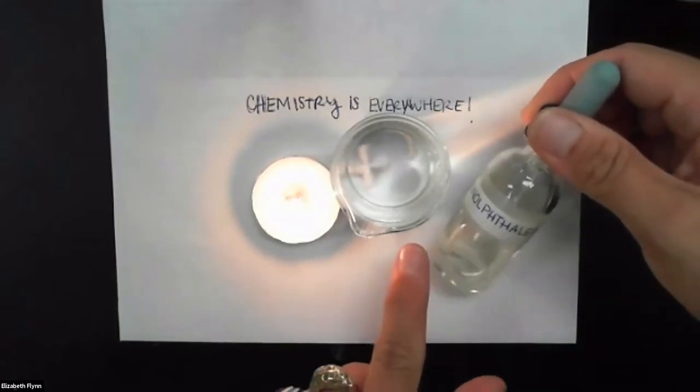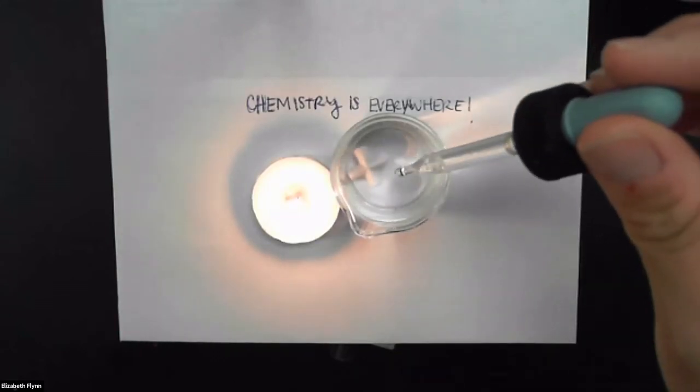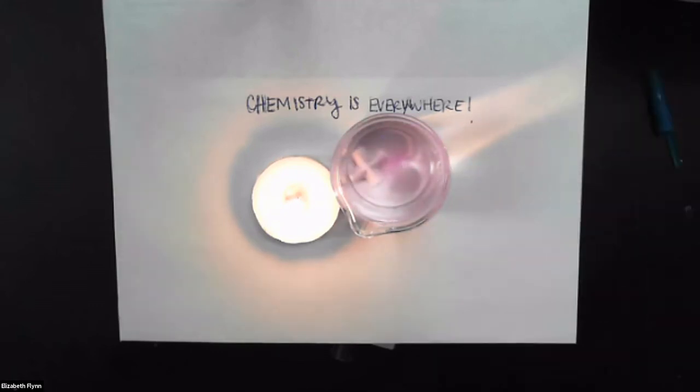But I can make a chemical change occur with this indicator. This is an indicator that tells us that the solution is basic because when I add the indicator to the basic solution, the indicator turns pink. And so that is also an indication that a chemical change has occurred. All right. So what we said we need to do is make sure that we can prove that oxygen gas is required for the chemical combustion to occur, the chemical change, and that carbon dioxide and water vapor are formed.